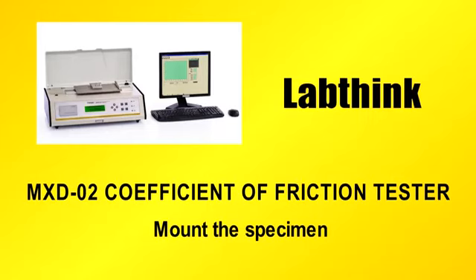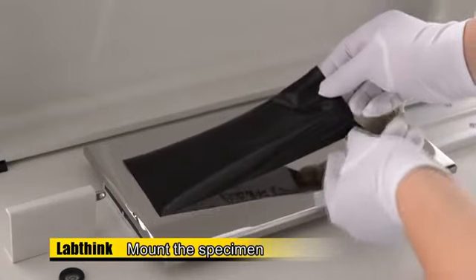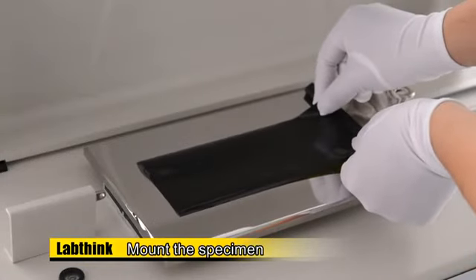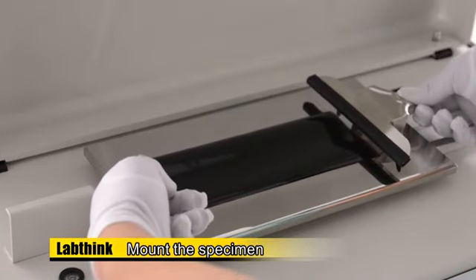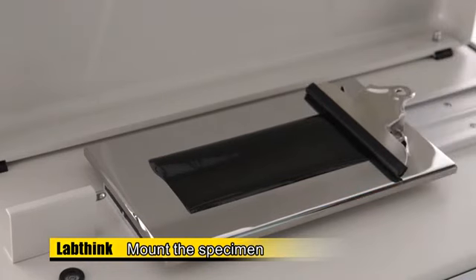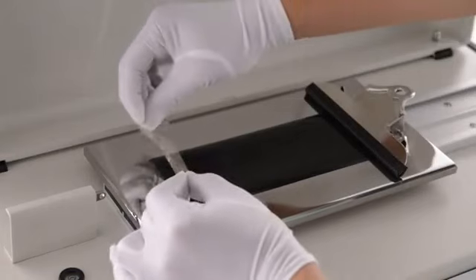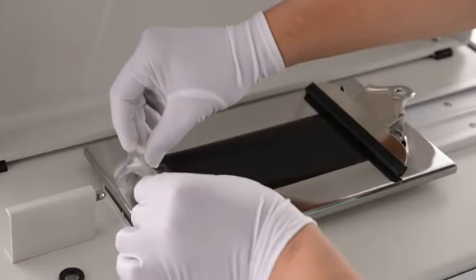Mount the specimen. Put the 200 mm by 80 mm specimen on the plane with the testing surface upside. Lift up the specimen clamp on the right side of the plane gently and insert one end of the specimen into the clamp. Release the clamp to fix the specimen. Make sure the length direction of the specimen is parallel to the machine direction of the plane. Tape the other end of the specimen on the plane if the specimen is curly.